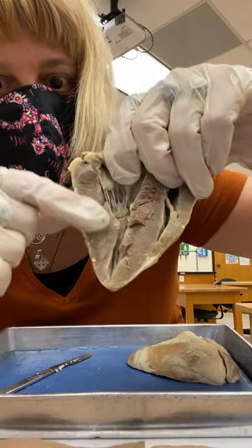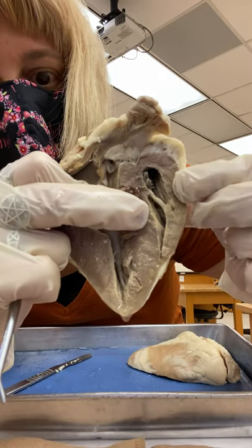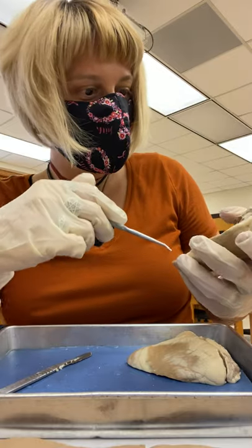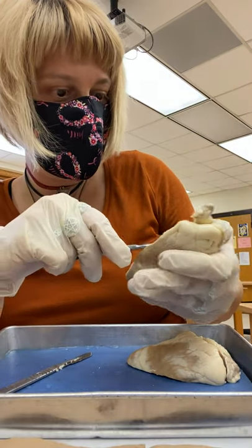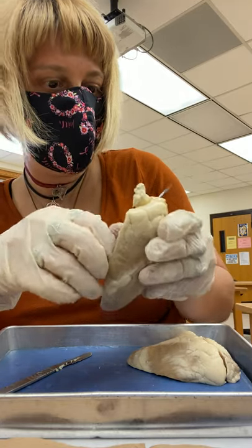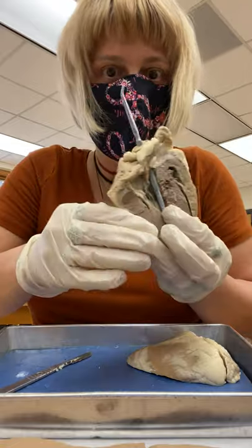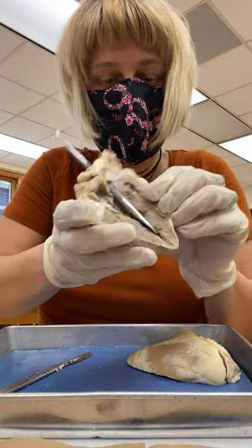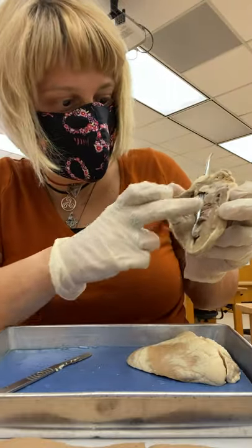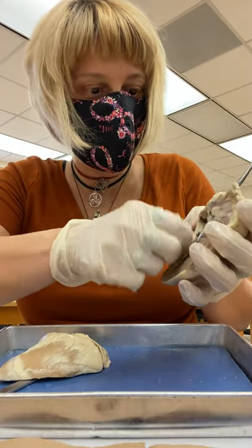How do I know that this is the ventricle side? Look how thick the ventricular muscles are compared to this — this is the right side. Let me show you one more thing which is really cool — if I take my probe, boom, that's coming from the ventricle. Here's my ventricle. There's the aorta. Because this is the left ventricle — that's pretty much it.